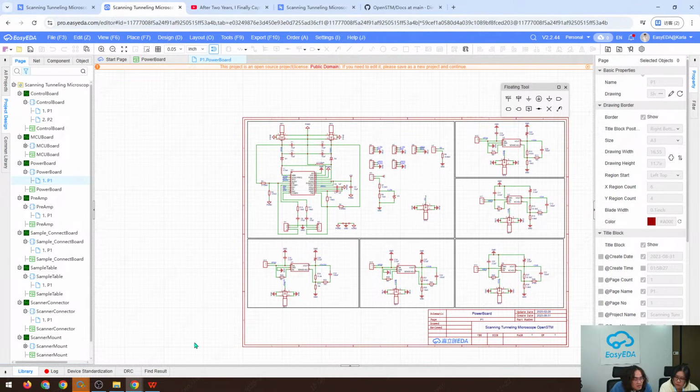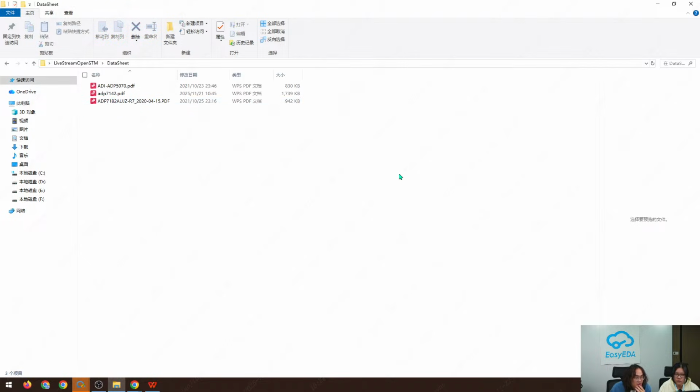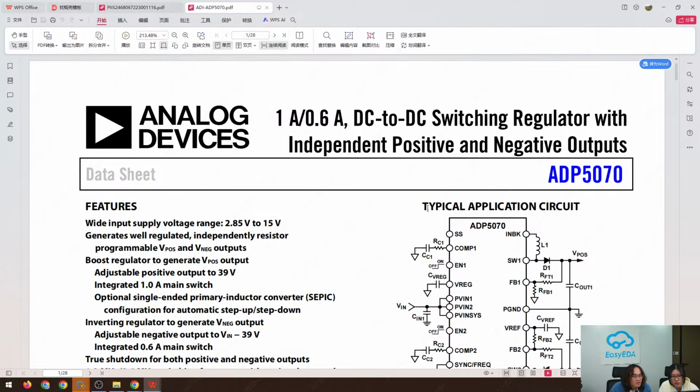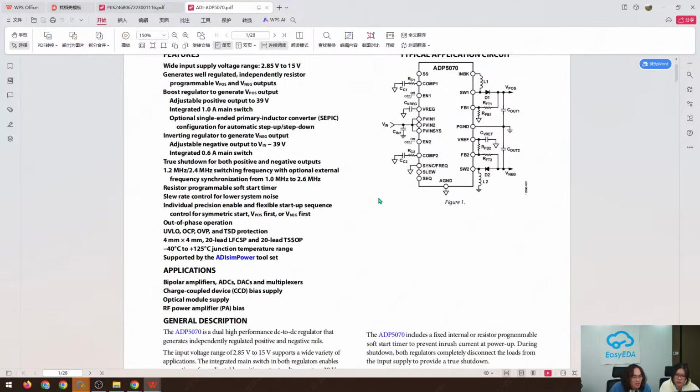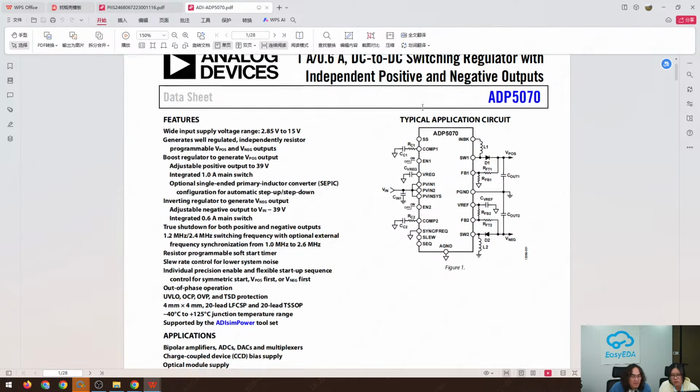And so before we begin our drawing of the power board, the best way to learn something about this chip is to read its data sheet, right? The component's data sheet. So the booster here, we can see the data sheet is from Analog Devices, and it is a DC-DC switching regulator, which can generate positive and negative outputs. And this is the typical application circuit.